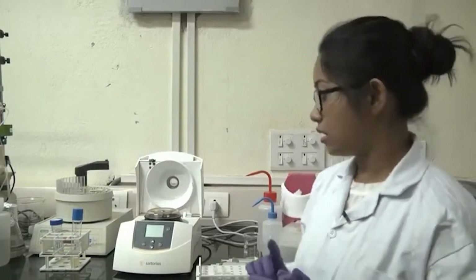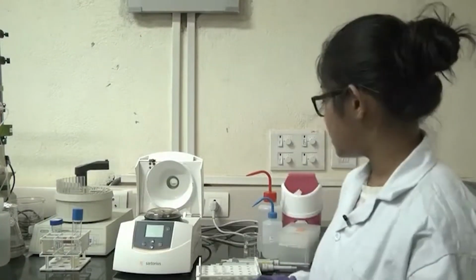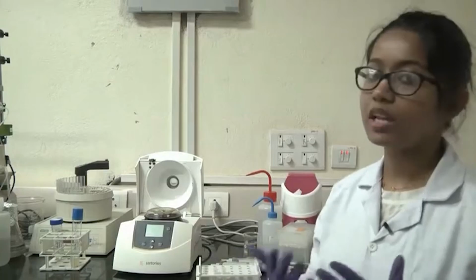So, I will be talking about these solutions and what these solutions contain and how these solutions help us to extract the plasmid. So, three things we need. One is the bacterial culture, an overnight culture, and that bacterial culture should have the antibiotic, and the antibiotic resistant gene should be present in that particular plasmid. And another thing is the centrifuge machine, so that we can centrifuge the cells, and also in the later steps we will need the centrifuge and the solutions which will be used.